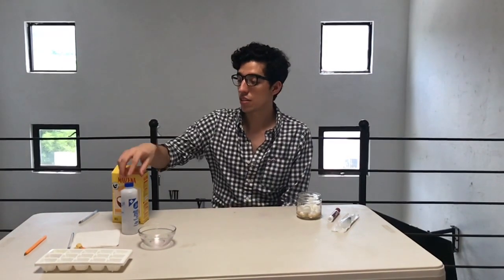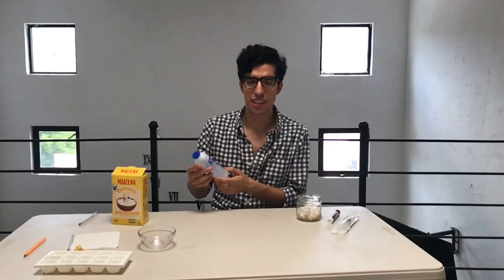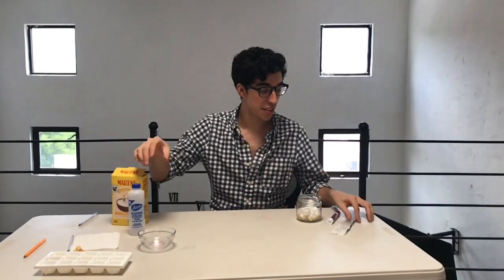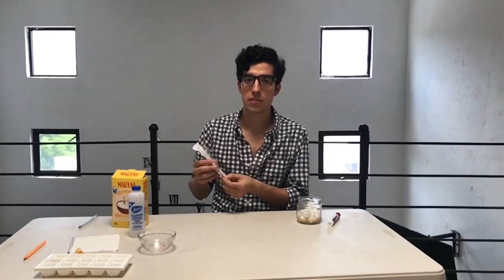In this video, I will talk about chromatography in column. We will do an experiment with things that we had at home. We only need ethyl alcohol. In this case, it's known as ethanol, a syringe. We won't use the needle, so we just remove it.